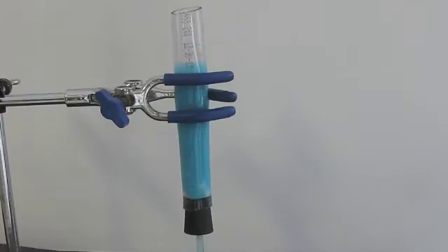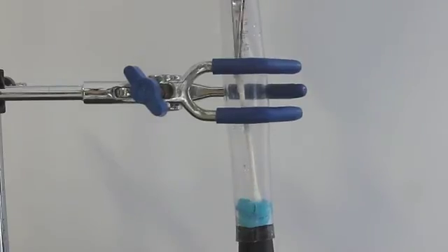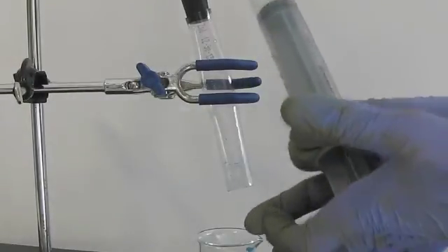This time when I pull on the syringe, you can see that the flow of liquid is much faster. Now continuously pull air into the syringe to draw the rest of the liquid out of the wet solid. Pressing down on the solids with a Q-tip or glass rod helps to force out any remaining liquid. Once you feel that your sample is dry enough, remove the cotton with some tweezers and use the syringe to blow out the solids into an appropriate container.